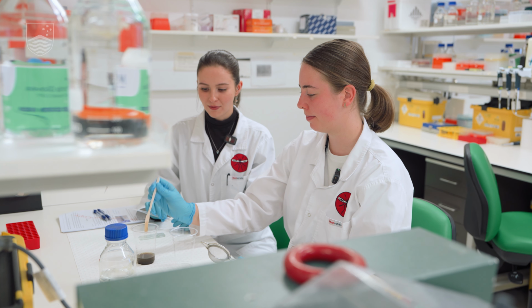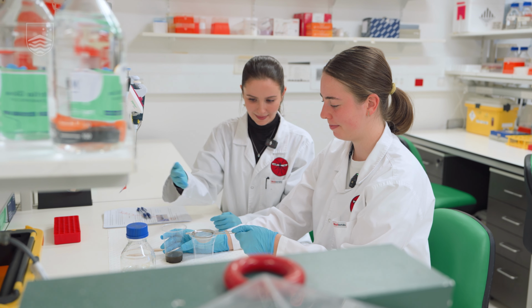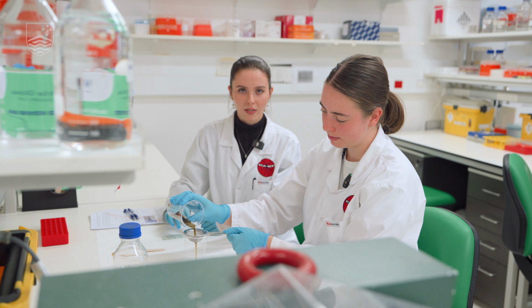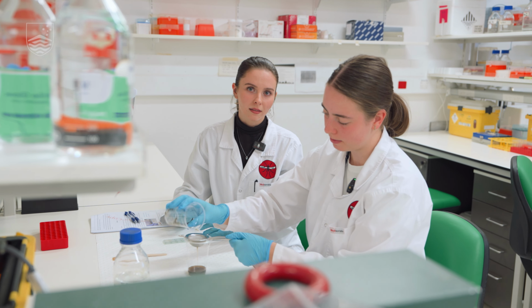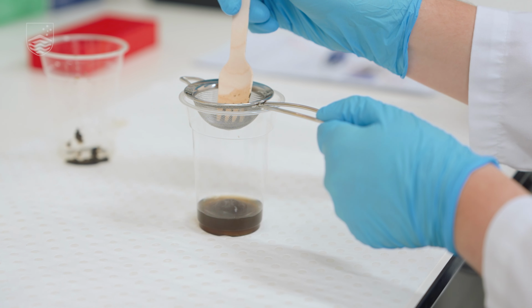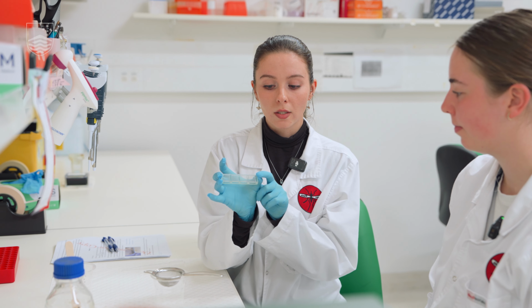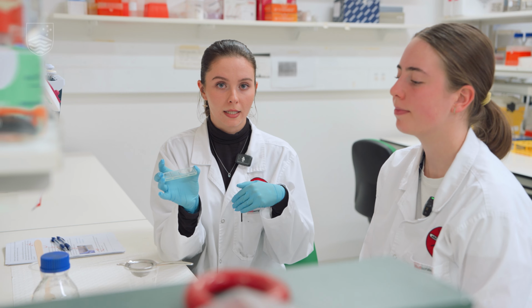All right, so the 5 minutes are up and we're just going to strain our poo mixture through essentially a tea strainer. This makes a more homogeneous mixture, in which we will be able to clearly see any parasites or strongyloid eggs. We've got this Whitlock chamber, which allows for a defined volume of this mixture in each little channel. There's grid lines on the top, which we'll focus on under the microscope, and we'll use those grid lines as a guide for counting the eggs.